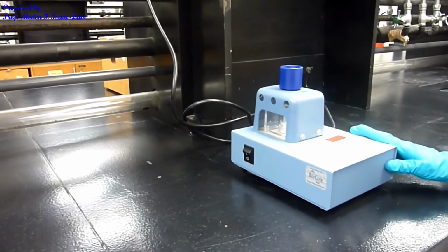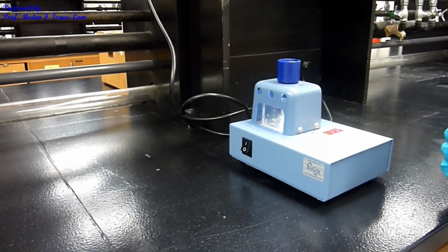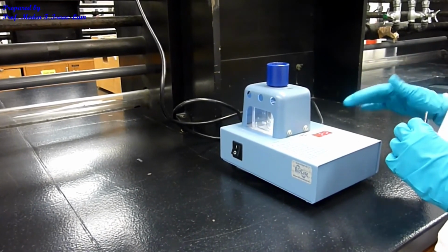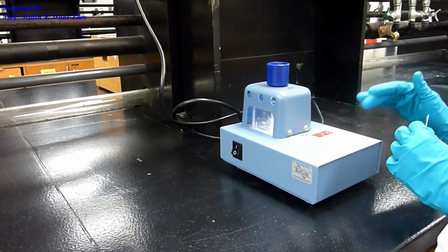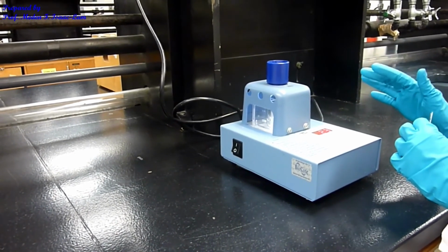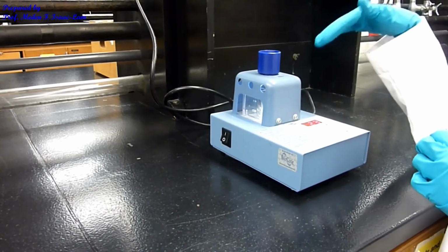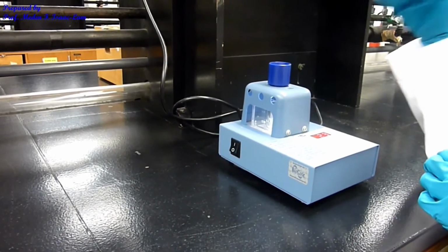This is the melt temp apparatus, or the melting point apparatus, and I'm going to turn it on. There's a rocker switch on the side, and since I know the melting point of pure benzoic acid, I will set it at that temperature, but slightly lower. So the melting point of benzoic acid is 123, and then I'm gonna set it to about 121 or 122, because typically the ones reported in the literature are slightly higher, but the actual temperature is slightly lower. So I'm just gonna set it to slightly lower temperature, and I plateau it at that temperature.